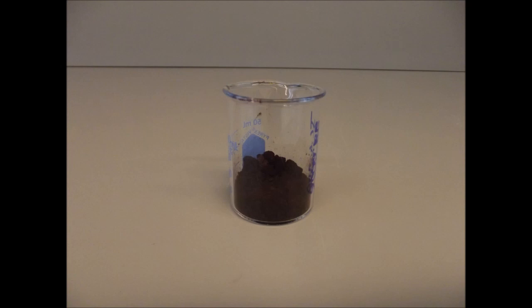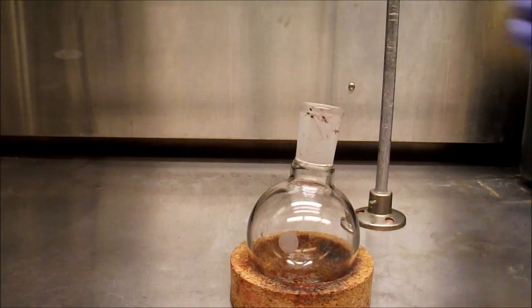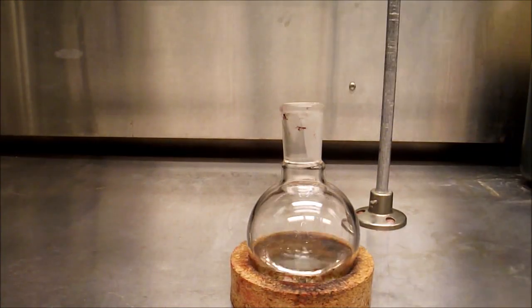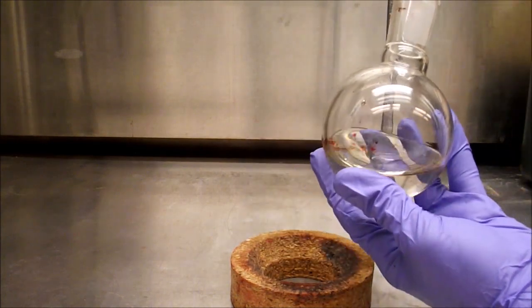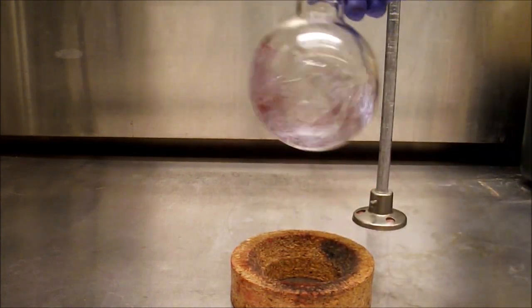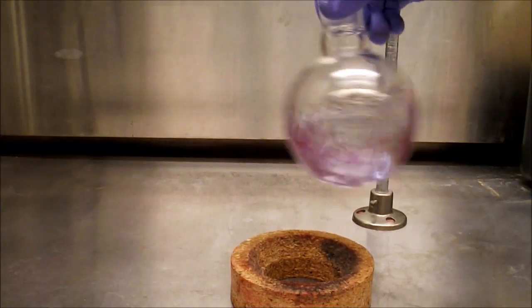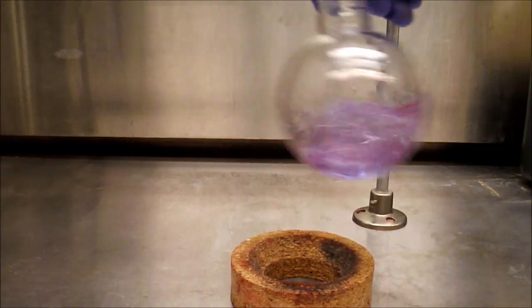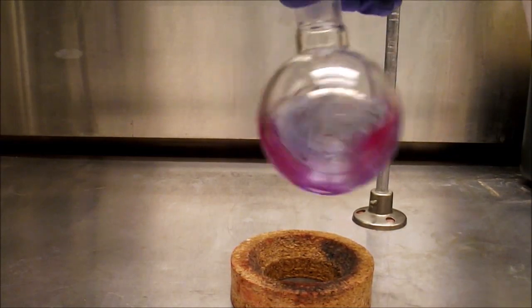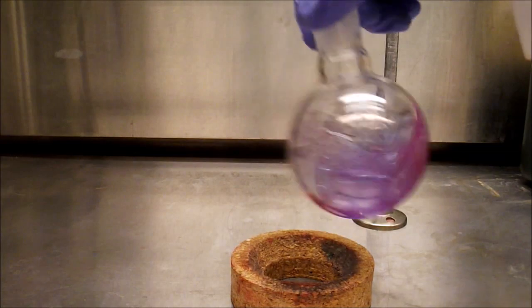After drying the product in air overnight, we obtained 5.4 grams of NH-PDI which corresponds to a yield of 86%. This product is only very poorly soluble in most organic solvents and can be challenging to clean from glassware. We found that the residue is readily removed by treatment with basic alcohols. We believe that this removes the proton from the pyrrolic nitrogen, forming a salt that is more highly soluble in organic solvents.